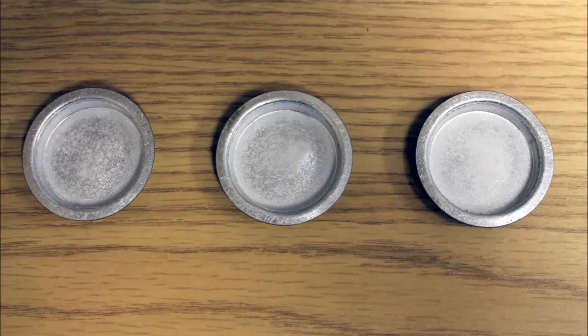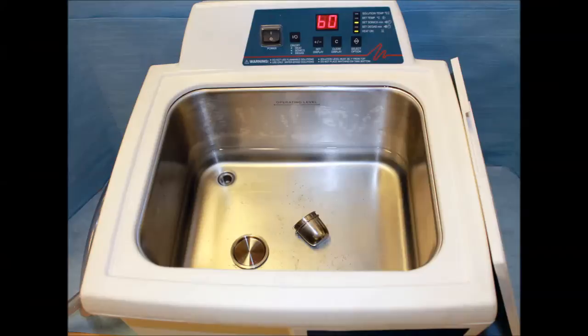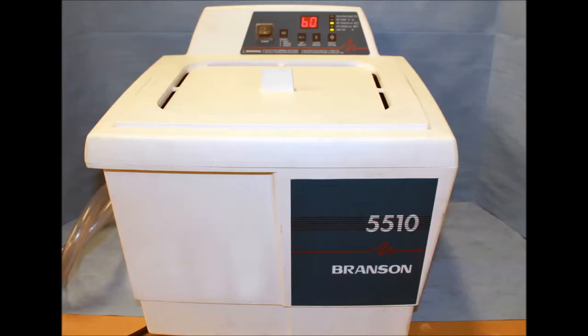To start the polishing process, the labware first needs to be properly cleaned. To do this, the labware is immersed into a citric acid bath at about 20% strength, heating to 70 Celsius for about 1 hour. Some samples may need more time, and possibly a more aggressive cleaning method as well. This can be done in a sonication bath as seen. Once finished, rinse the labware and begin the polishing process.